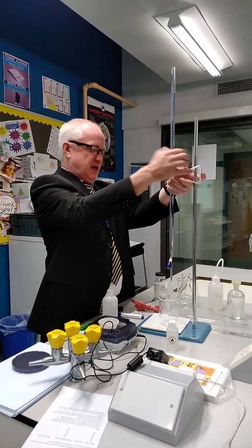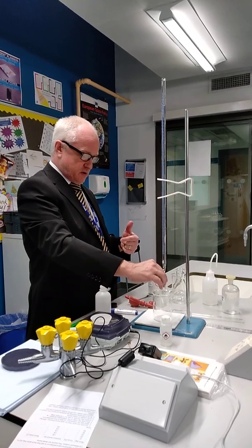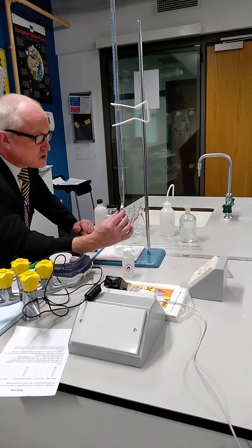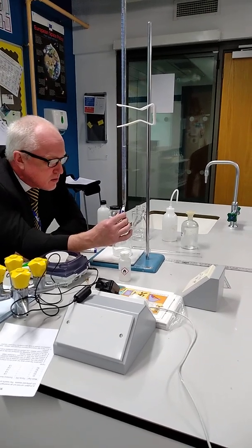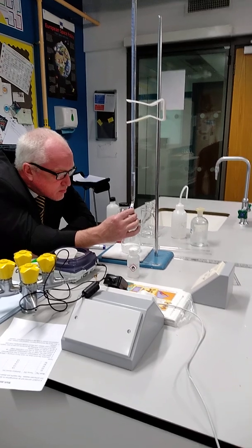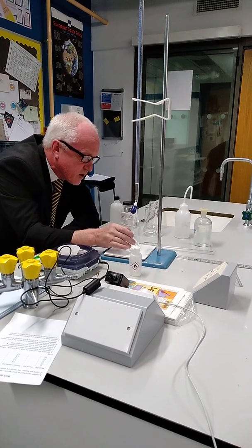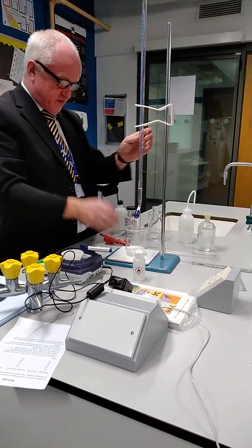The sodium carbonate is in the beaker. It's obviously going to fizz because we're going to get the reaction — it should fizz as we add it. But we're going to add the full 50. I'm going to add it carefully at the bottom so I add exactly 50; I don't want to go over. So I add it slowly at the bottom. Now I've added exactly 50. There's still a drop at the bottom — I'll just tap that off. Give it a swirl, making sure it's all dissolved, and then I'm going to add a second 50 cubic centimetres.